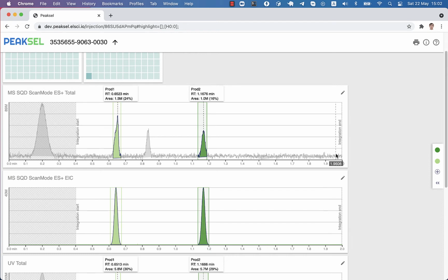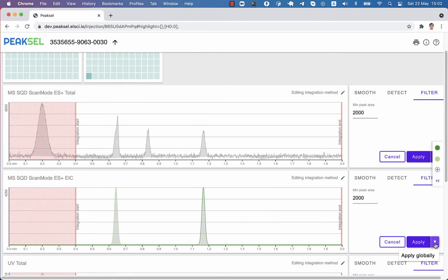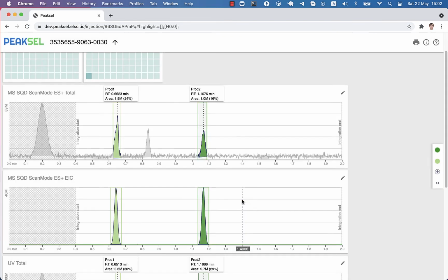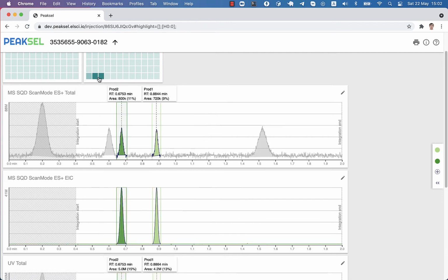Now, since I have many injections in this batch, I'd like to apply it to all of them. For that, instead of clicking Apply, I will choose Apply Globally, select Apply to the whole batch, and then save it. This reintegrates all the injections in the batch, but note that only chromatograms with the same name are modified.